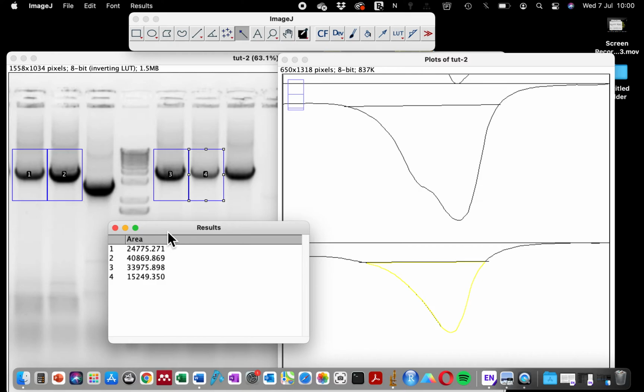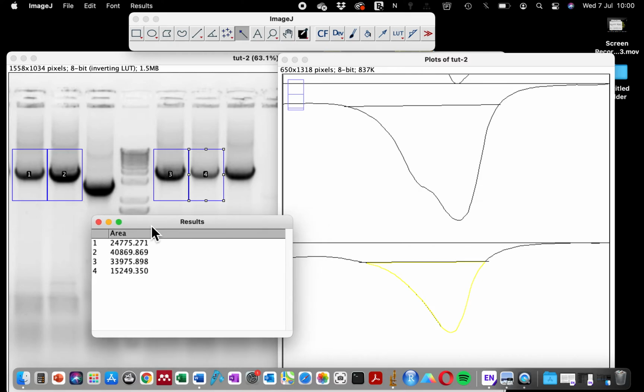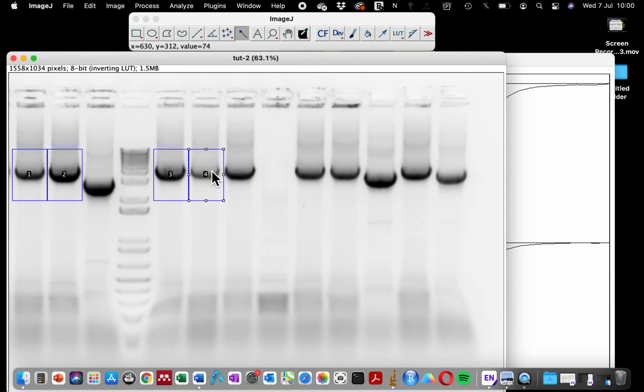But let me quickly troubleshoot this for you so that you can understand if you are having a weird quantification in your gel. Sometimes we make a little mistake, and it's normal for us to make mistakes, but just watch this. I'll make it in 1 minute so that you can see what I meant.